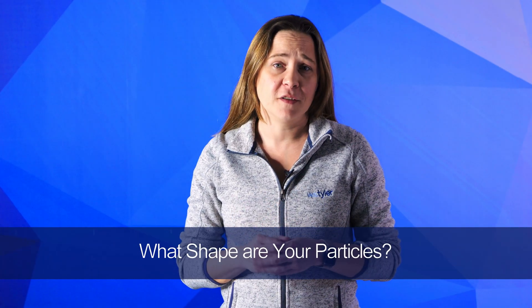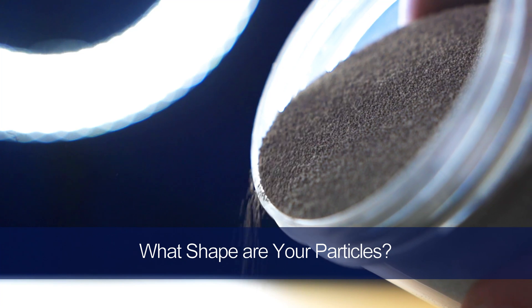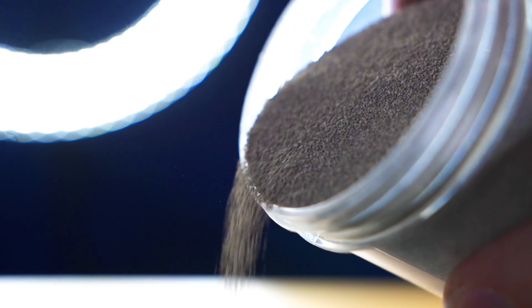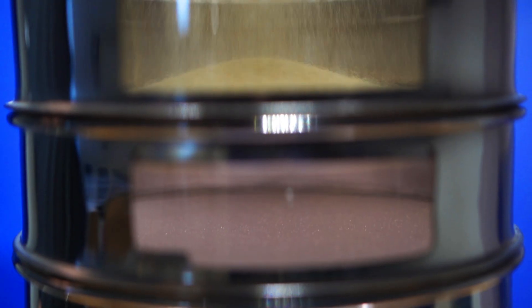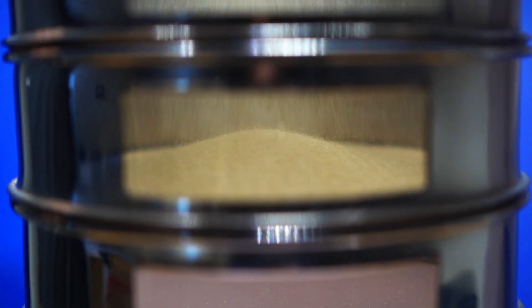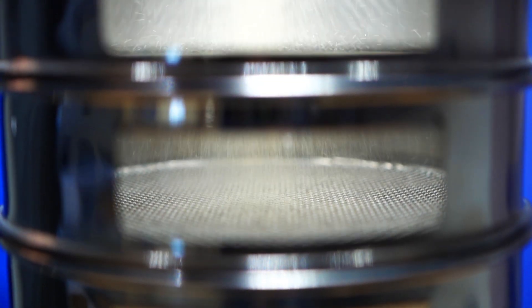You can sieve all types of particles in a sieve shaker, but the shape of each individual particle is going to impact how your analysis goes. Round or nearly round particles will take much less movement and time to fall through than an elongated or irregularly shaped particle. For those elongated or irregularly shaped particles, there are sometimes other actions you need to take to get them to sieve correctly. If the particles aren't oriented correctly, they may not fit through the openings in the sieve mesh properly.